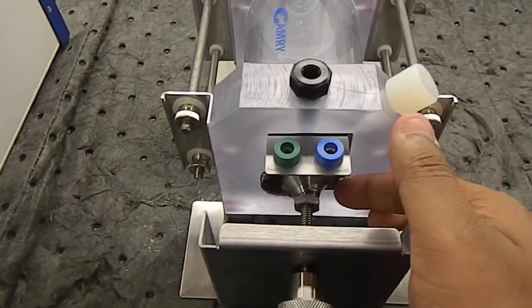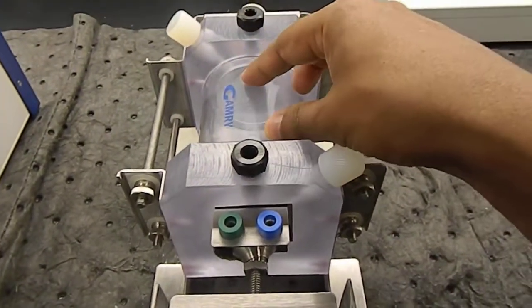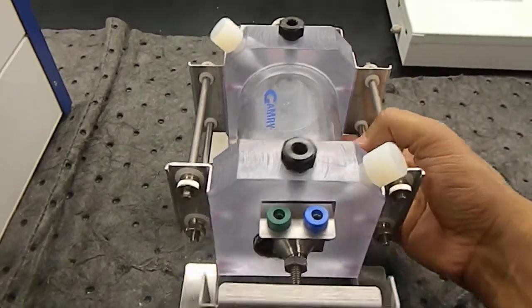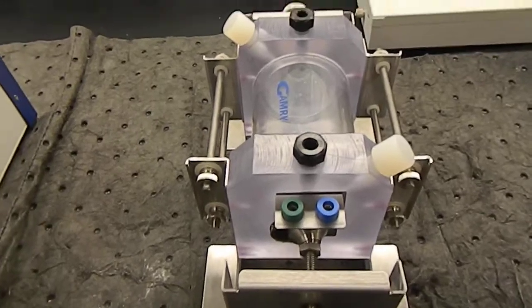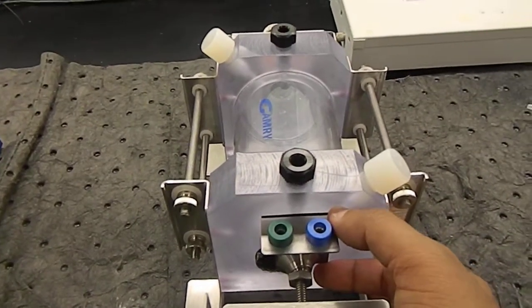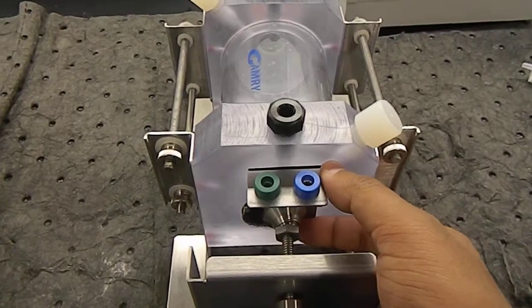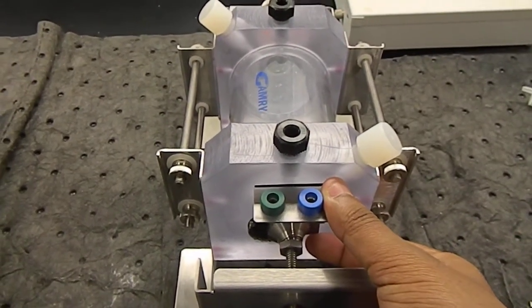In our case, we used the metal magnesium, actually magnesium alloy AZ31, and the corrosion fluid we used was a phosphate buffer solution. We used phosphate buffer solution because it is nothing but simulated body fluid, and we wanted to see how magnesium works against body fluid, because our application is to use magnesium as an implant material.